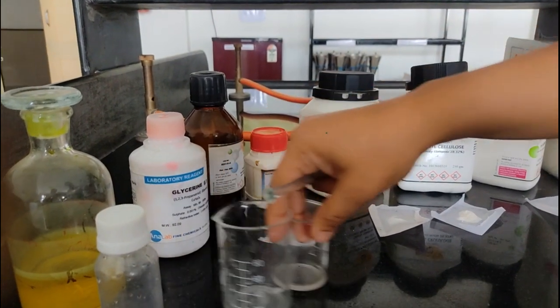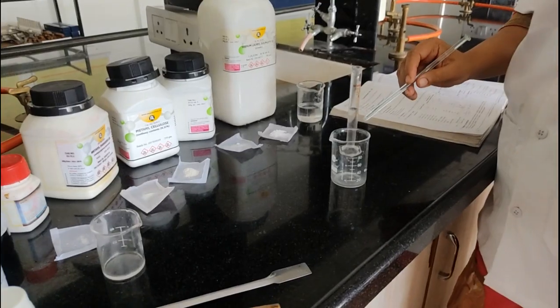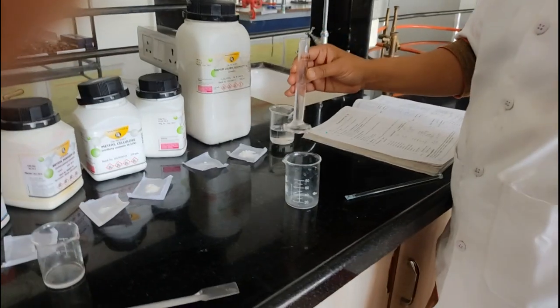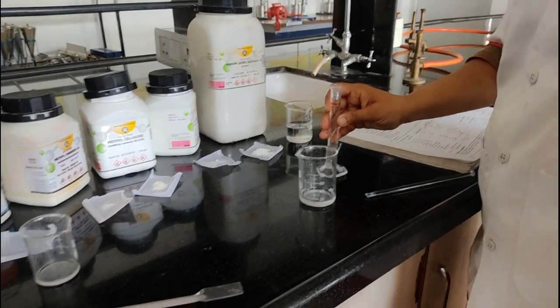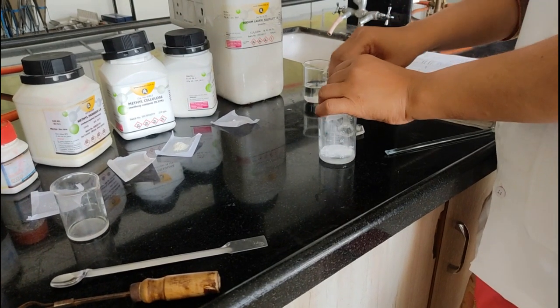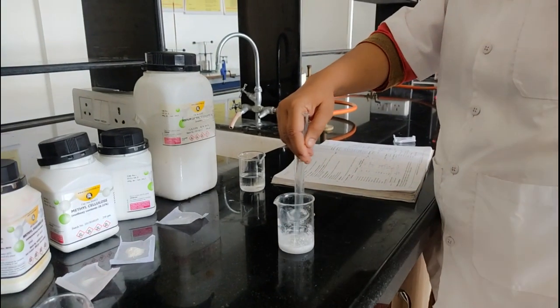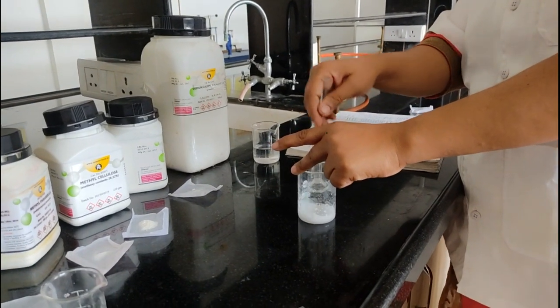For apparatus we require beakers and spatula. First, take a beaker and add 7.5 ml of water (75% of the total volume). Then add the required quantity of sodium lauryl sulfate — 1 gram. Sodium lauryl sulfate is used as a surfactant and foaming agent. Mix it well and dissolve the sodium lauryl sulfate properly in the water.